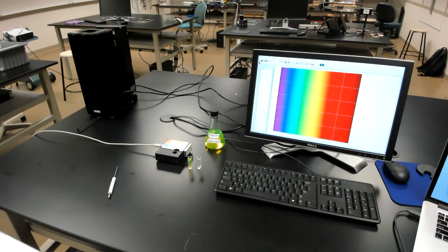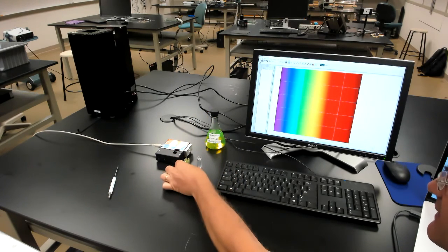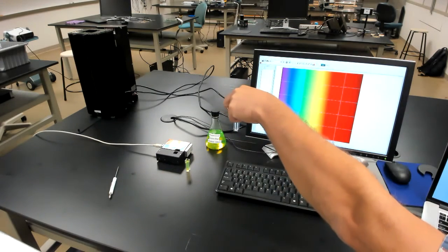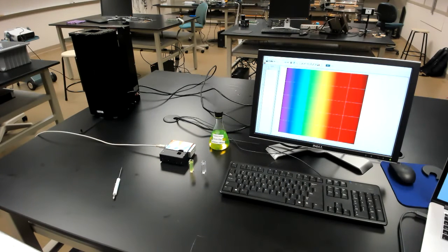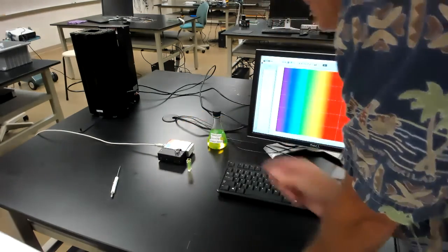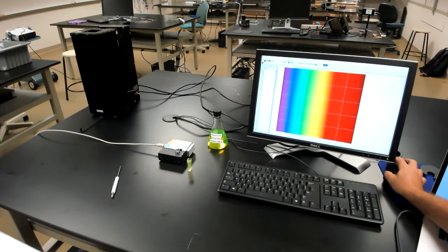All right. Next, remember that every transmission measurement actually contains two measurements. A measurement of our sample, this, but also a reference measurement, a measurement of the spectrum of the source and any other components in our experiment. The way this equipment is set up, we'll start with a reference measurement, and we're going to measure a cuvette that contains only water. So let me place that in the system, and then we'll have the system carry out a transmission measurement, and this one will be for calibration.